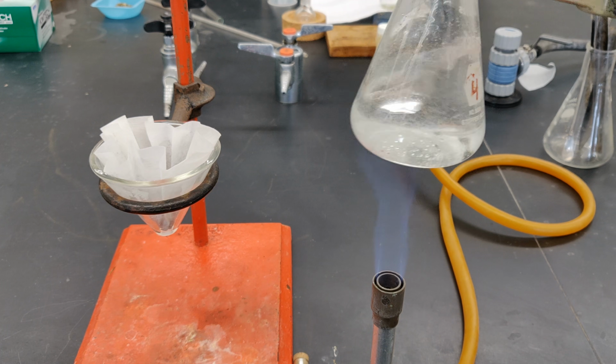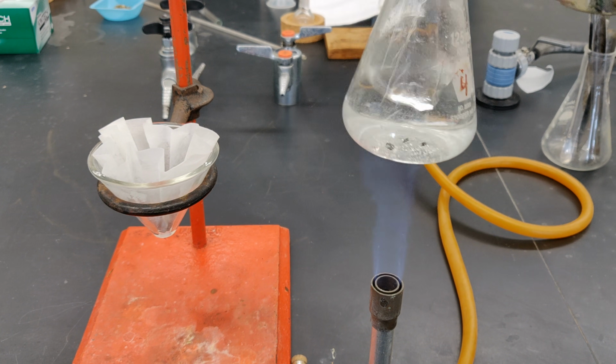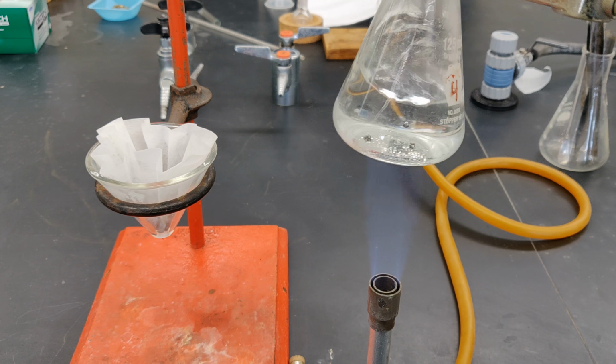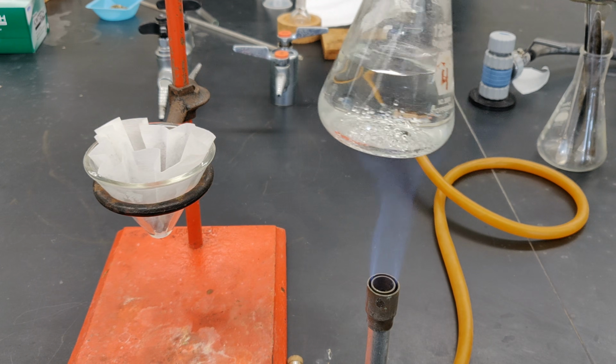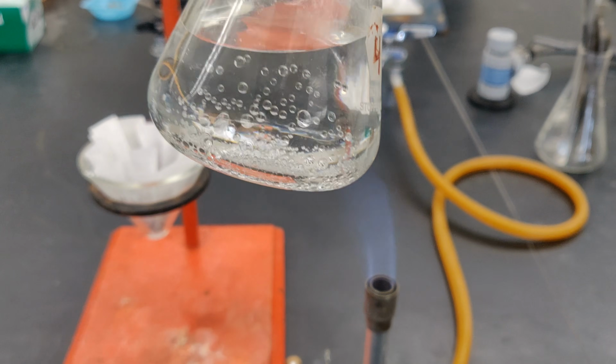Note that the point of reheating the solution is not to boil water. You're heating it to redissolve the solid. So if a clear solution is obtained before the water begins to boil, you can stop heating at that point. The solution is now clear and no further heating is required.